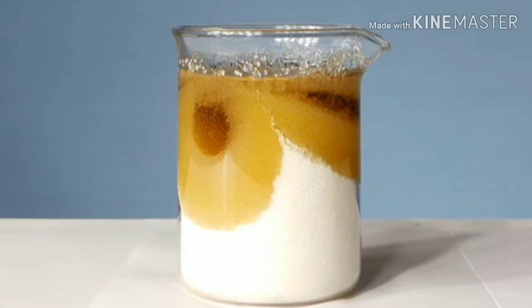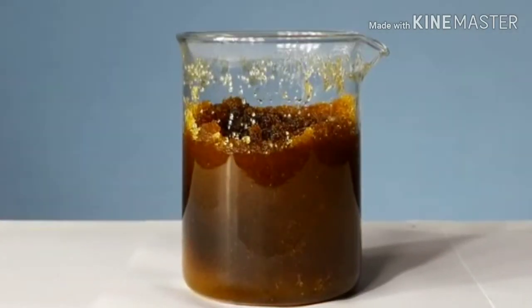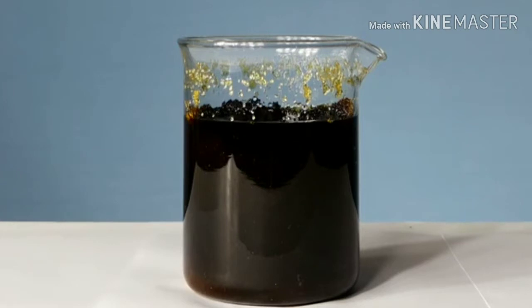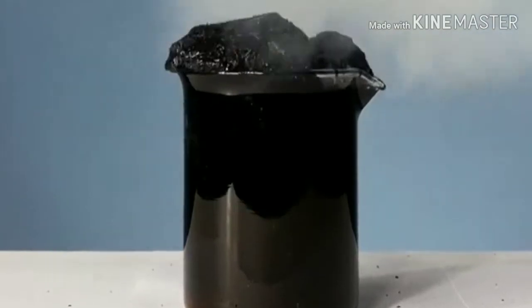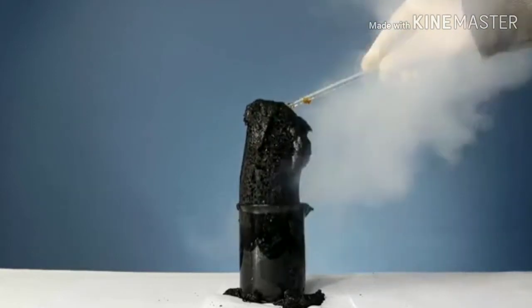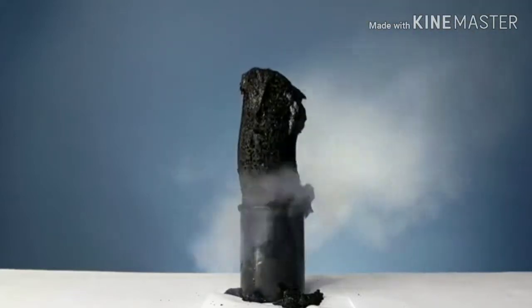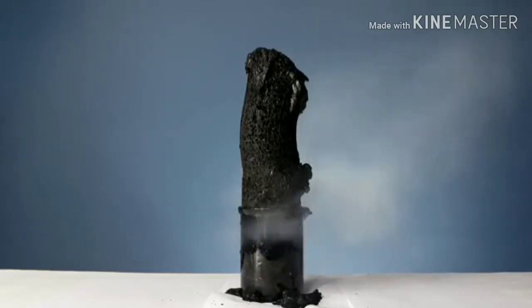Safety is always really important when you're pulling off these kind of stunts. In this experiment, sulfuric acid is being combined with regular table sugar. Let's watch as the chemical reaction happens. The molecules from the acid are reacting with the molecules from the sugar, causing a pretty pronounced change — that's why you're seeing that giant tower start to come out of the beaker. The tower is something brand new; it's being changed into carbon, and the gas you're seeing come off is a brand new gas called sulfur dioxide.